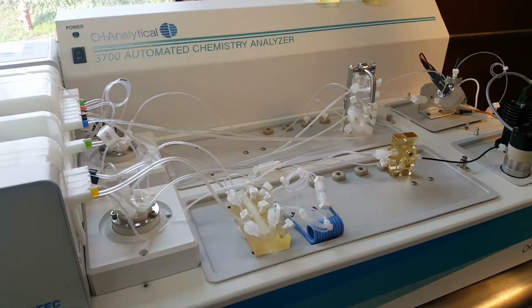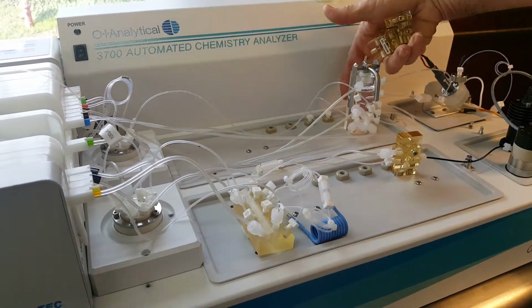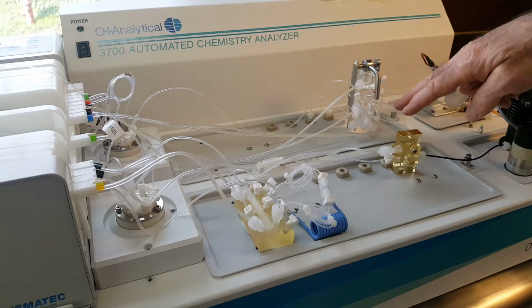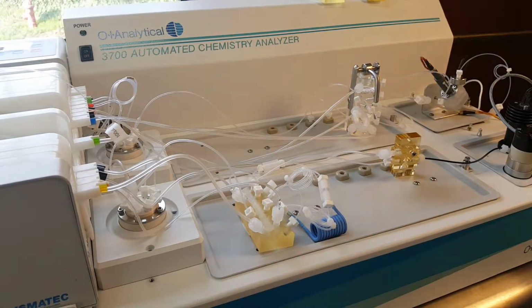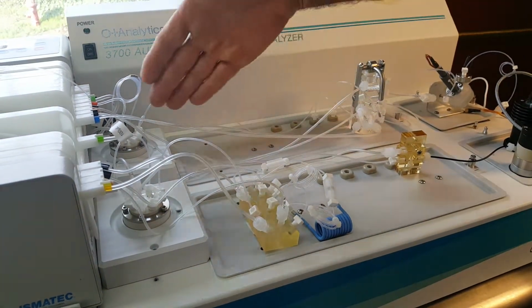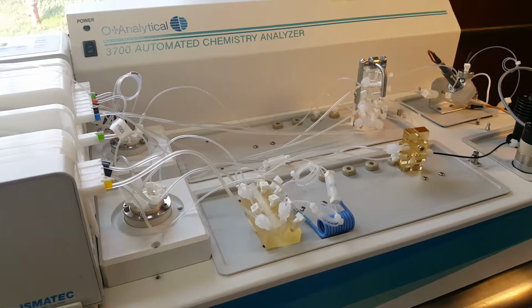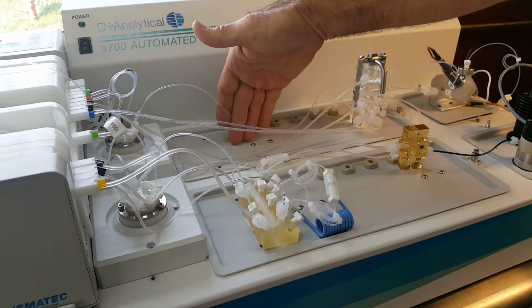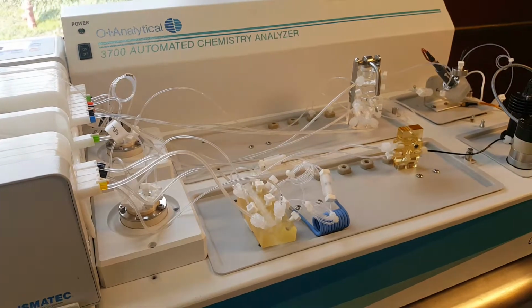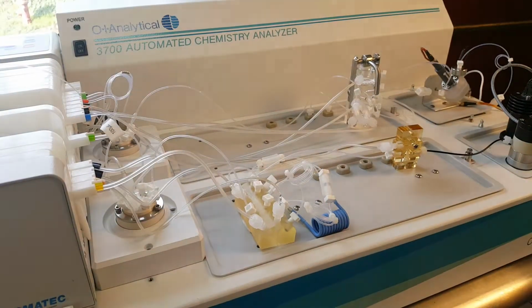On this side we have the total cyanide configuration, which once again we removed all the mixing tees and we put them on a single manifold. Now in this case it's exactly the same thing, same manifold, it's just the manifold has the tees built into it. Absolutely zero difference in functionality. All the connections come directly to the manifold, go to the UV module, come back and go to the flow cell. In this case as well, if you wanted to add a gas diffusion module of, say, WAD, you easily could do that. And then whichever one you were running is the one that you would use.